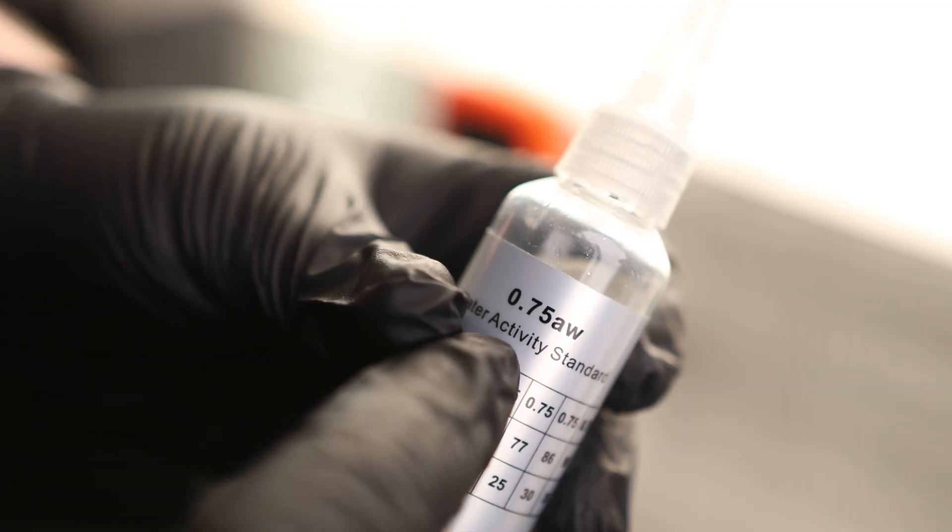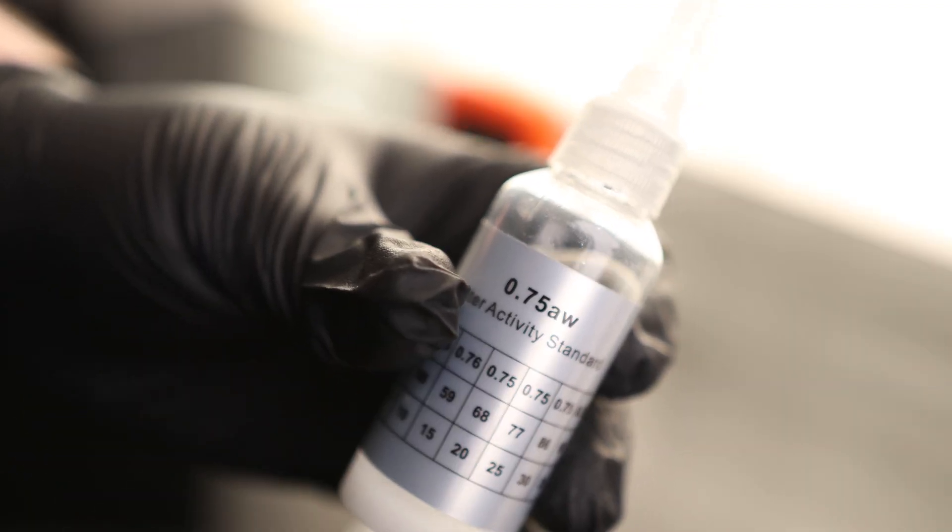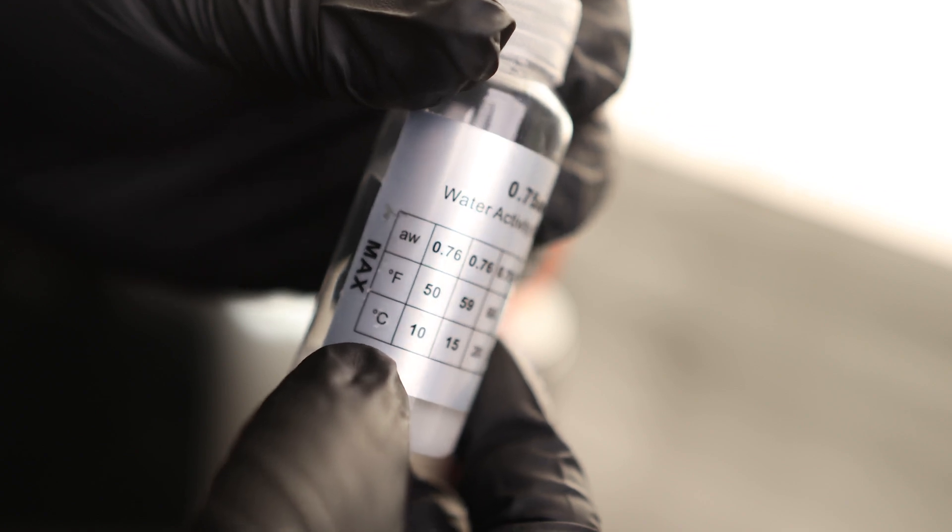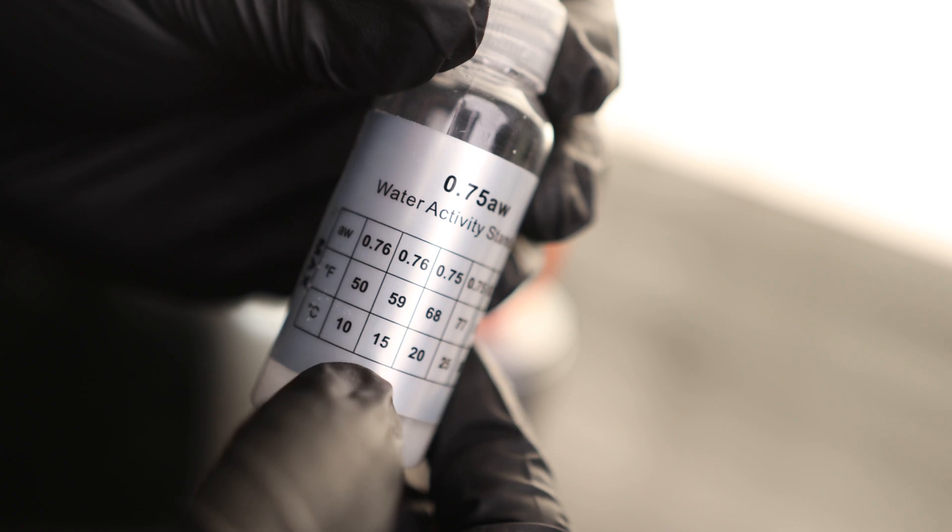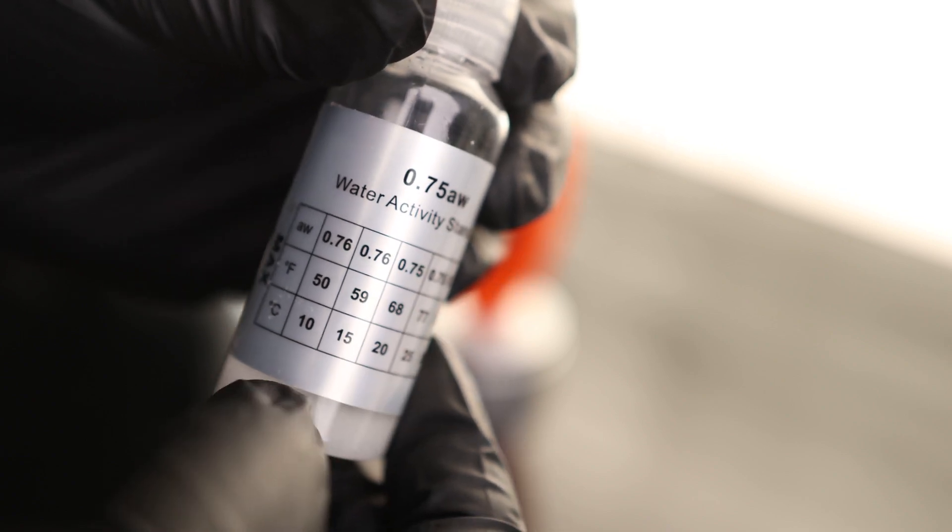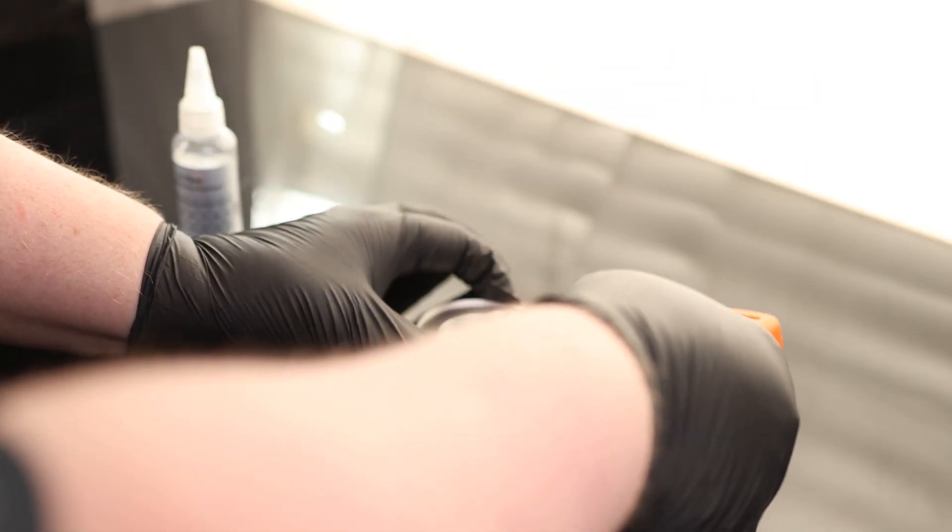You do want to have clean hands or use gloves. We can see this solution is a 0.75, so we should get a 0.75. You can also see on here that depending on the temperature, we might get a different reading. It's 0.75 pretty much across the board until you get to about 59 degrees Fahrenheit or 15 degrees Celsius. So hopefully you won't be working in those conditions.